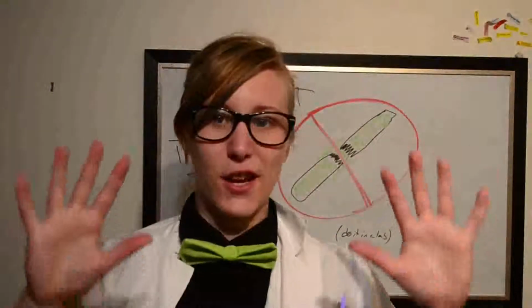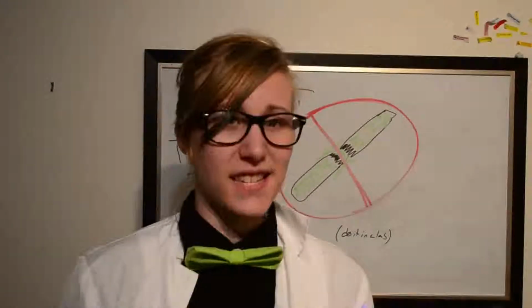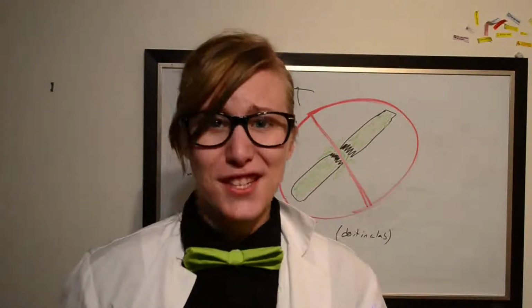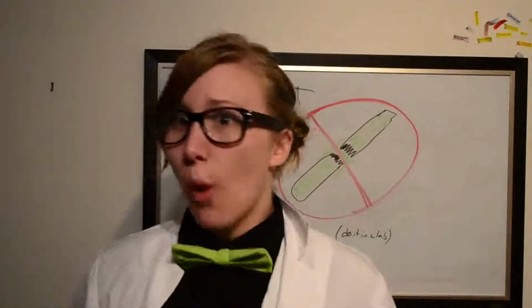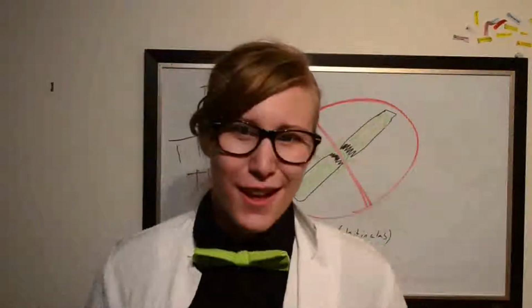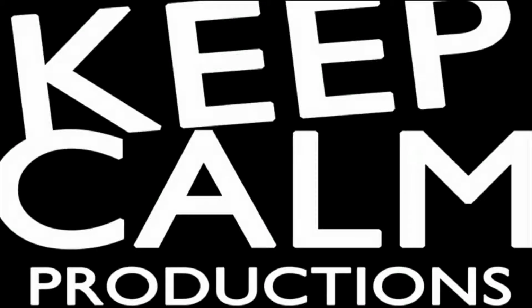I got it all on my fingers and all in my feet. Diphenyl oxalate is also all over my face and hands. It's non-polar, which makes it horrible to clean up because it doesn't wash away with water because it's not polar. Water's a polar solvent. Just, guys, just go forth and do science. Not in your parents' kitchen.